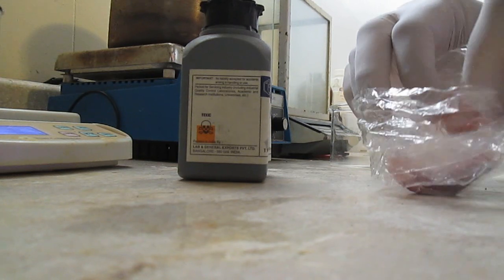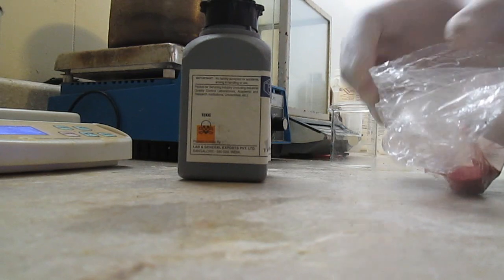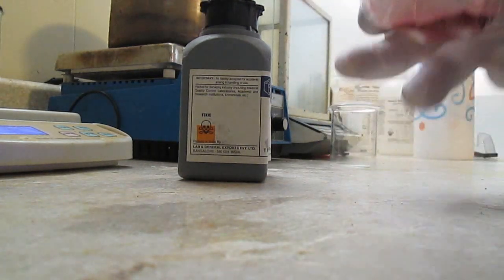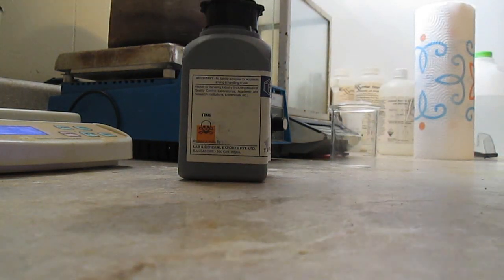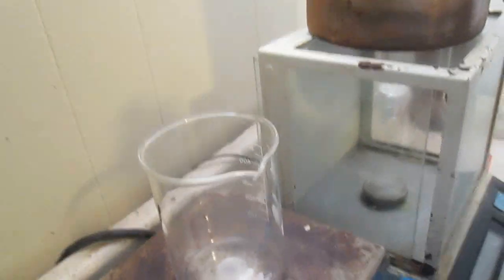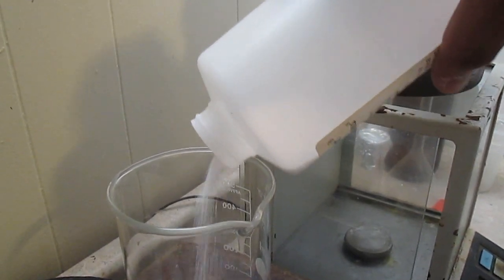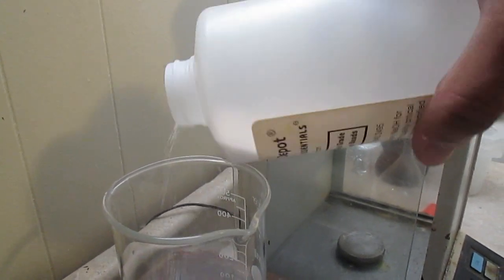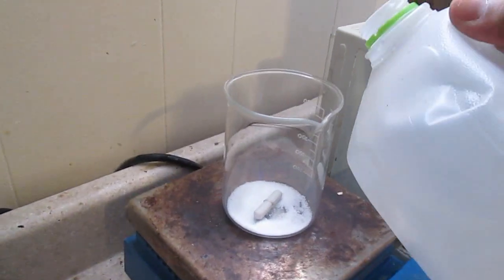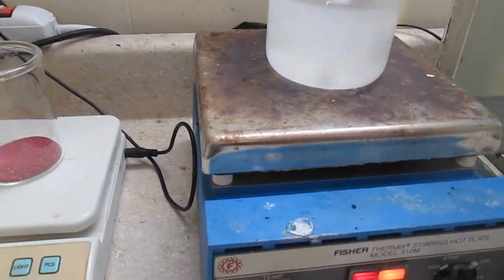This is cinnabar — finely ground rock found in nature. These are just the crystals, so it's not pure but it's fairly pure. I'm going to weigh it — we have roughly 33.7 grams. We're going to make a solution of sodium hydroxide, add a stir bar, a bit of water until it's fully dissolved and warm, then directly add sulfur to this solution.